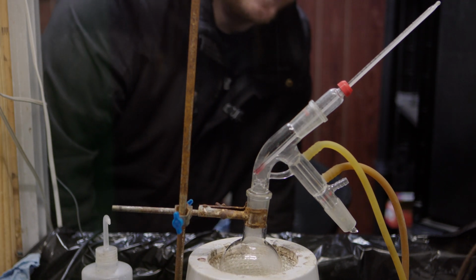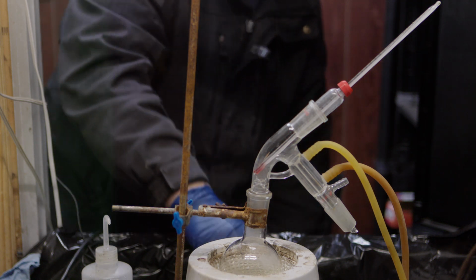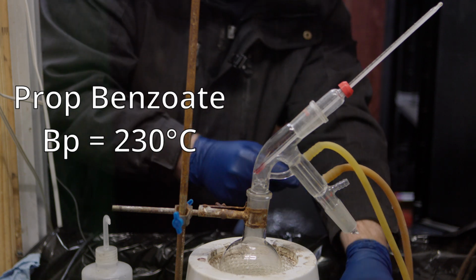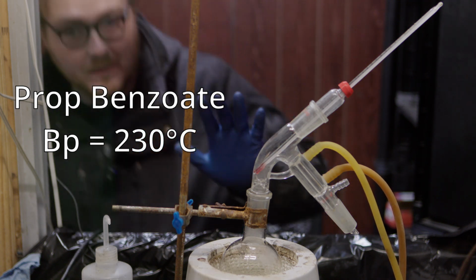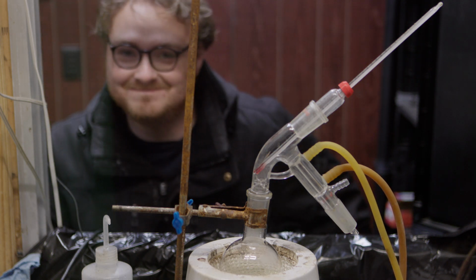Oh yeah. Oh yeah, I can smell it. Okay, I'm gonna switch collecting flasks and we're gonna start running that now. It smells like a cinnamon roll. I'm not gonna ruin the result, but there's definitely some smells going on.